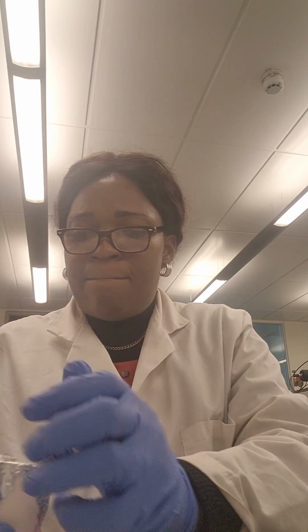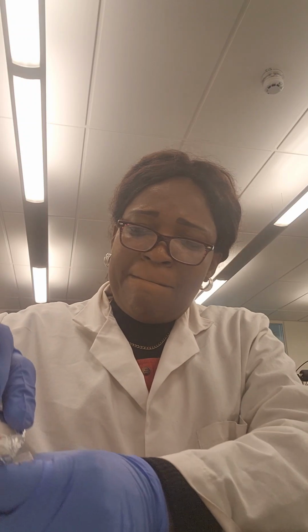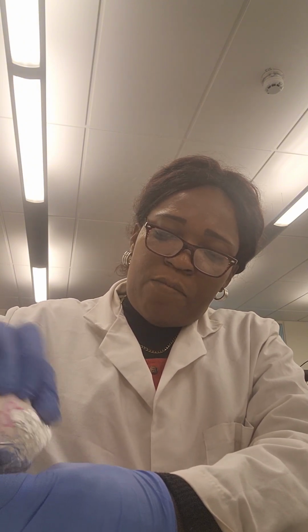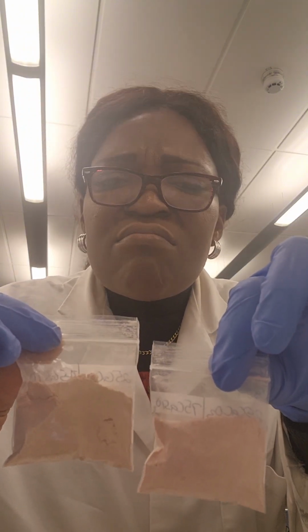let us see what happens at 800 degrees Celsius. You see, I had to heat it up a bit under shaking the sample inside, but it is still powdery. If you remember, calcium carbonate decomposes at around 784 degrees Celsius. So you could expect that at 800, decomposition would have taken place, or rather started. So you expect there will be release of calcium oxide and CO2 will be released out of the crucible.